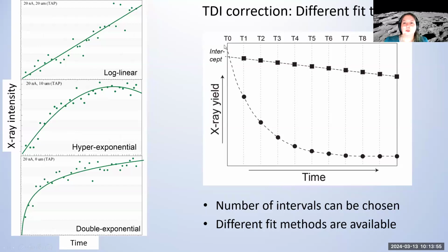And in the software, we can define the number of intervals, and it records all the data, and then the software has 3 different fit methods to the data that we can apply. And so we have log linear change, hyper exponential change, and then a double exponential function for it. And again, we have time versus intensity. And I don't know how easy it is to read, but essentially this is all the same material where I just changed the beam diameter during the acquisition.